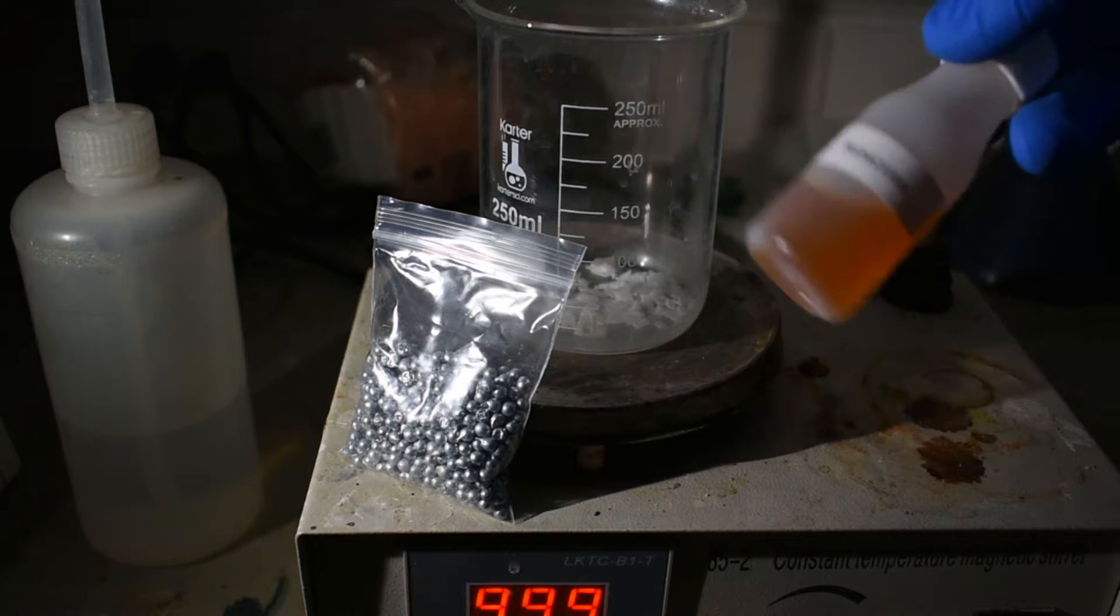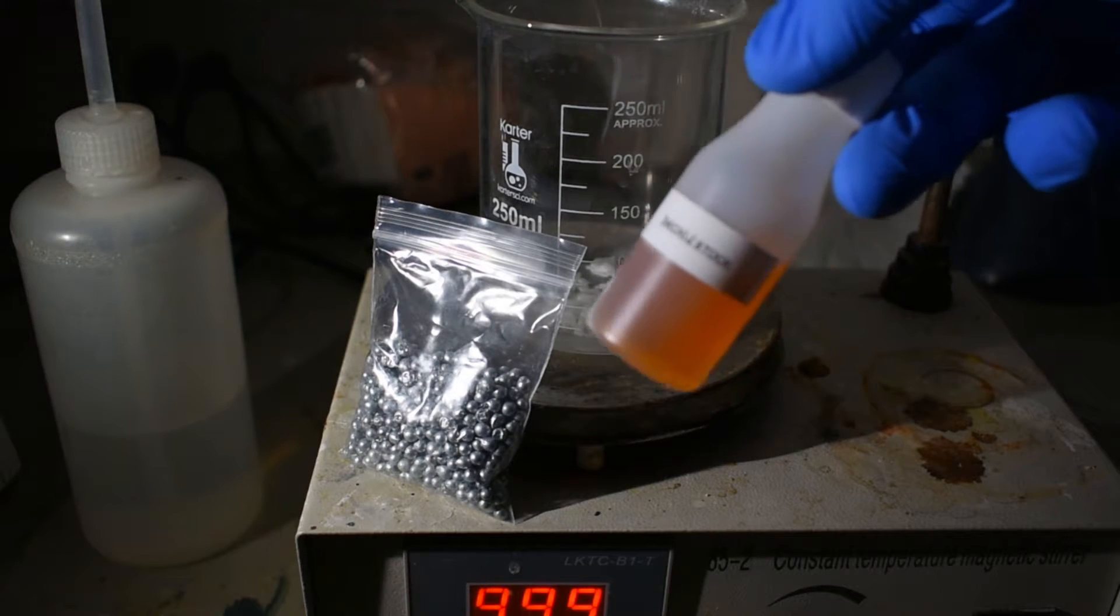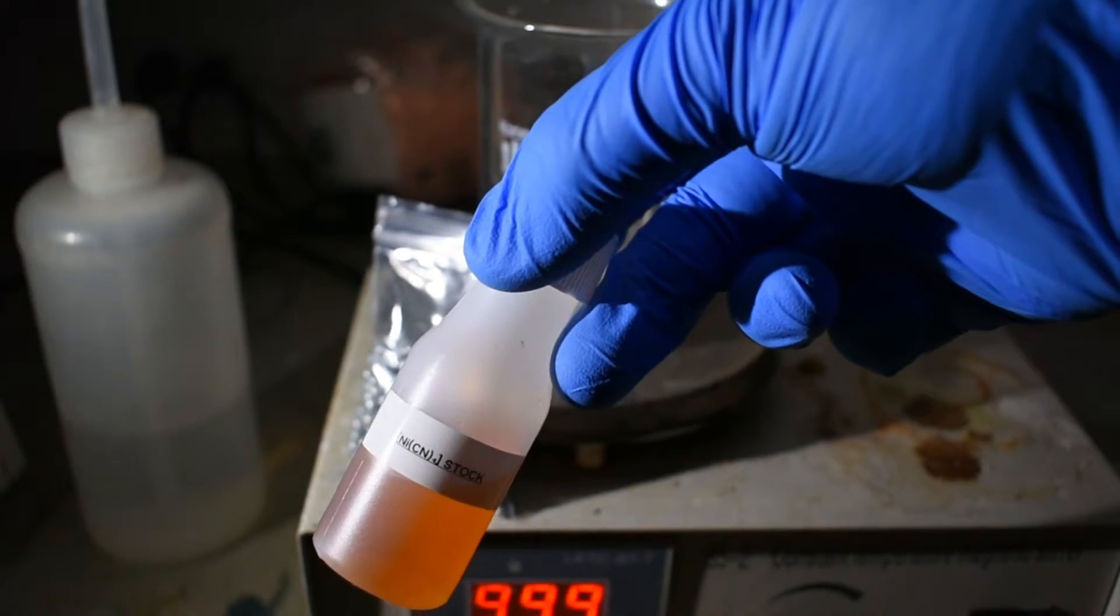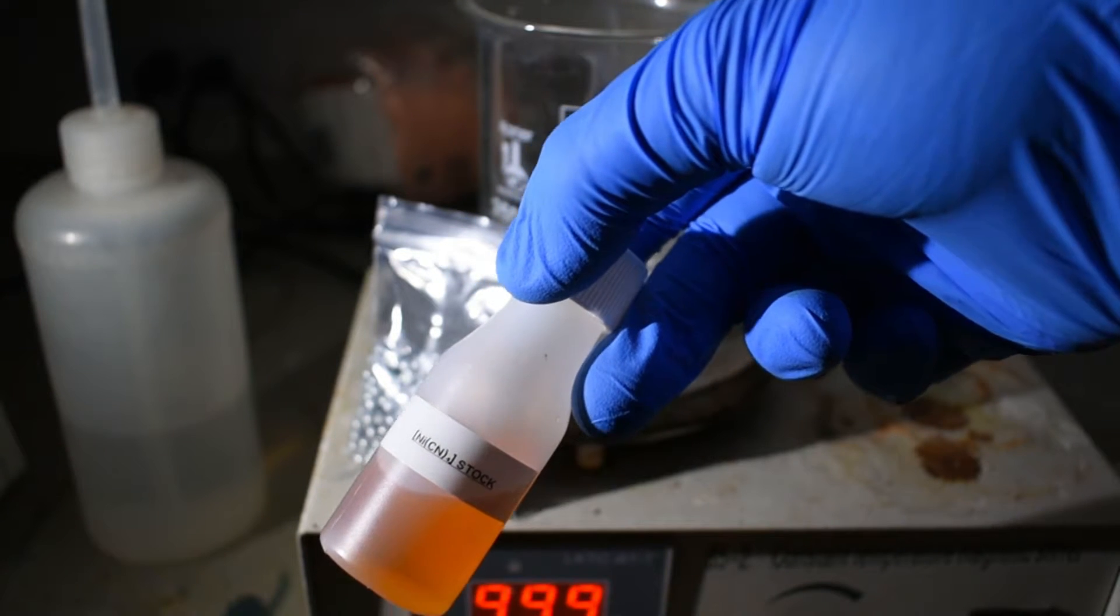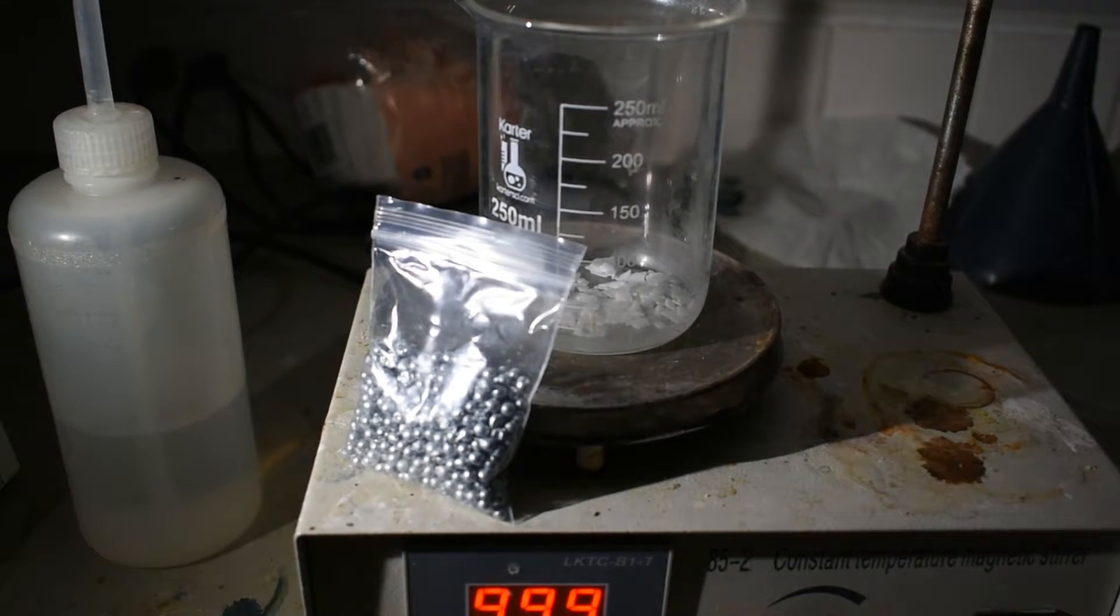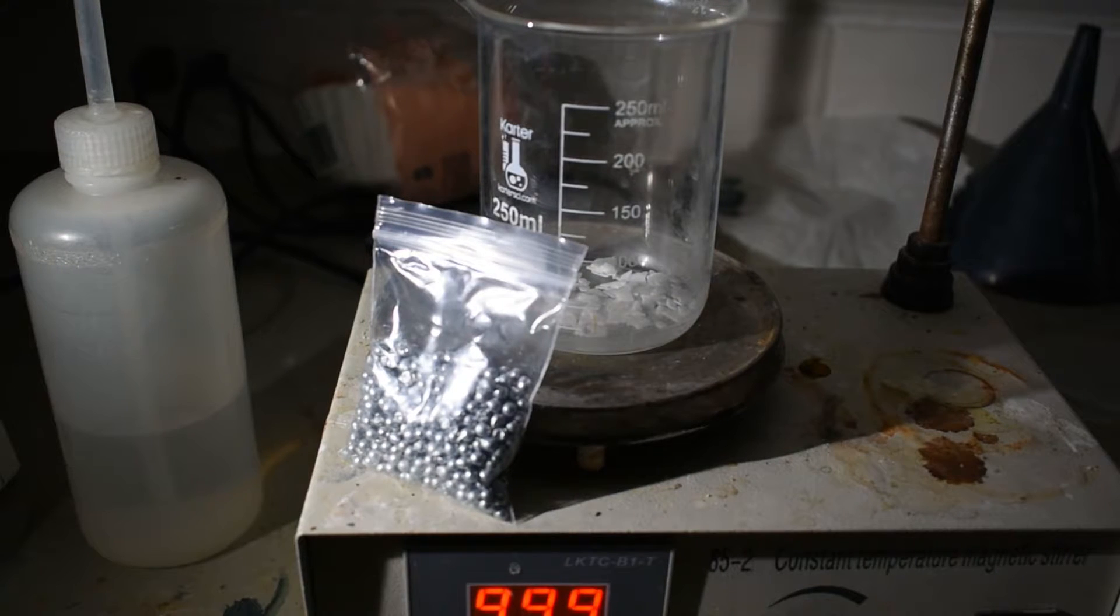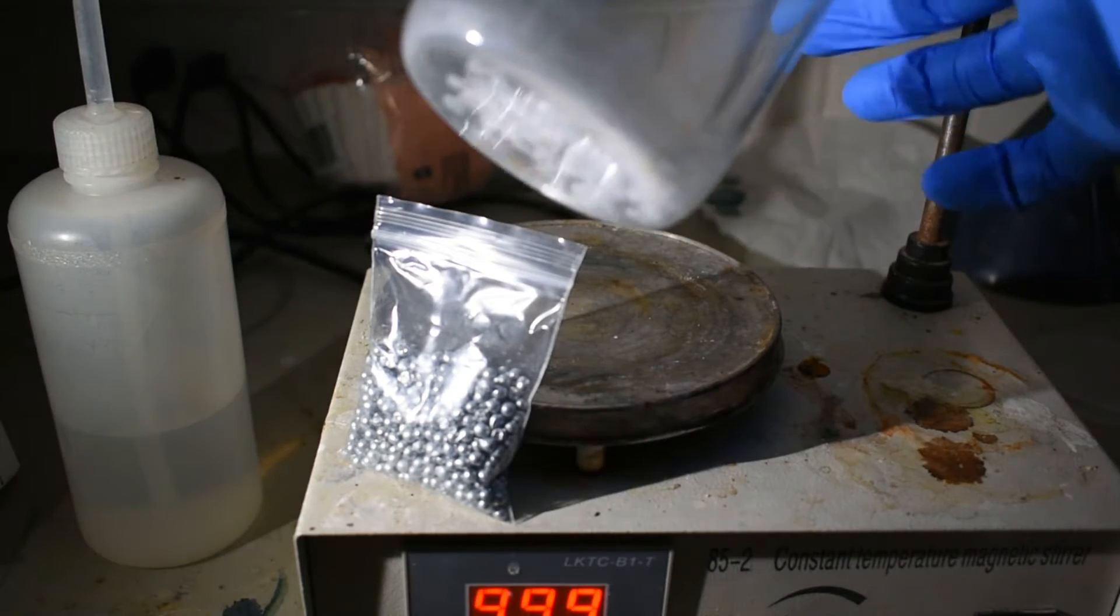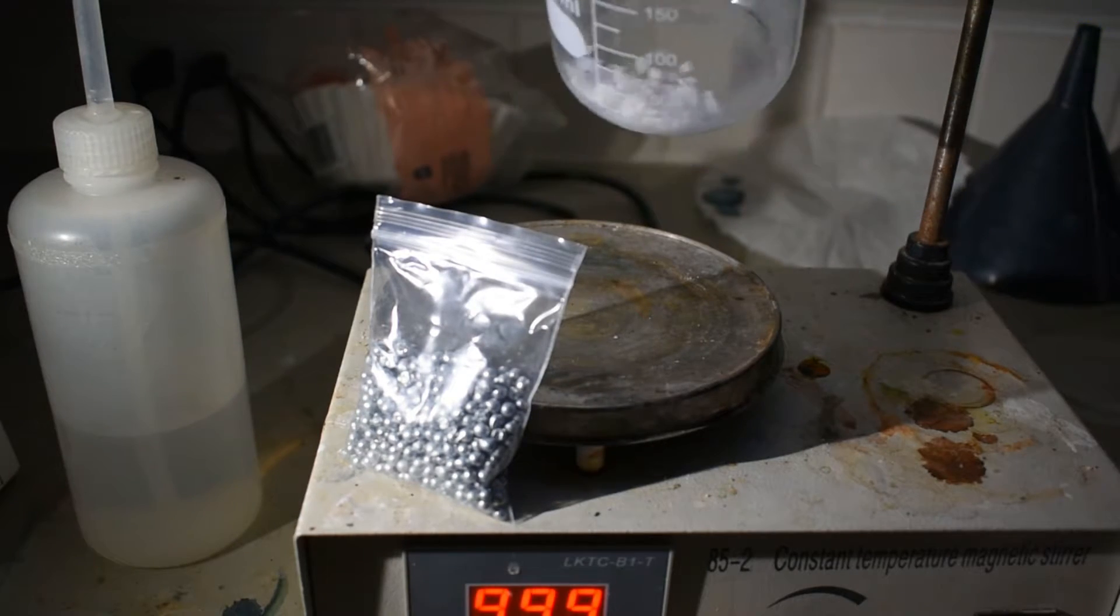Or, if you, for some odd reason, happen to have lying around a solution of potassium tetracyanonickelate, then feel free to use that as well. We will also need a base, which in my case is some solid flakes of potassium hydroxide. You can also use sodium hydroxide. That works just as well.